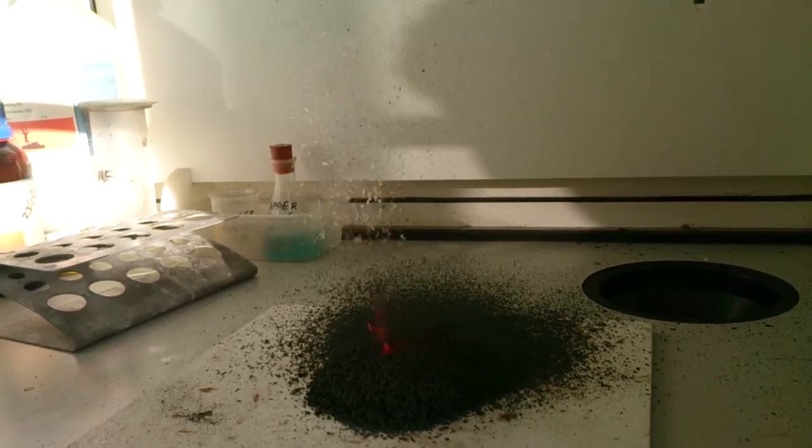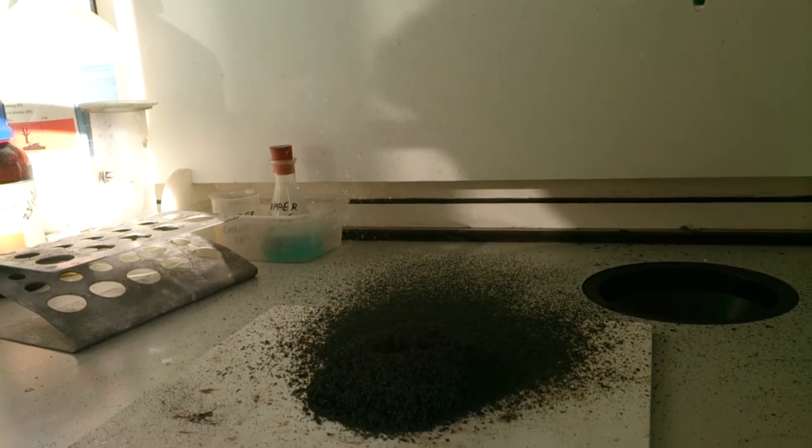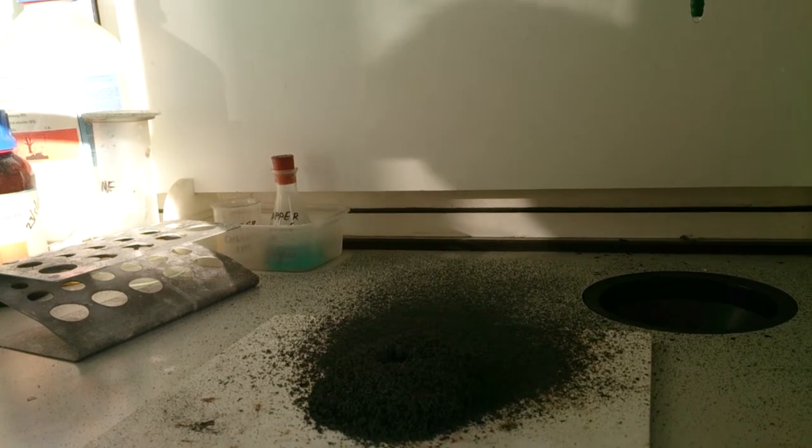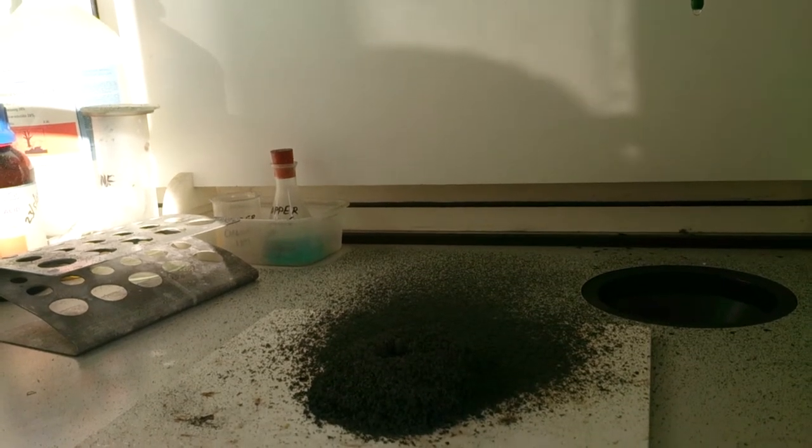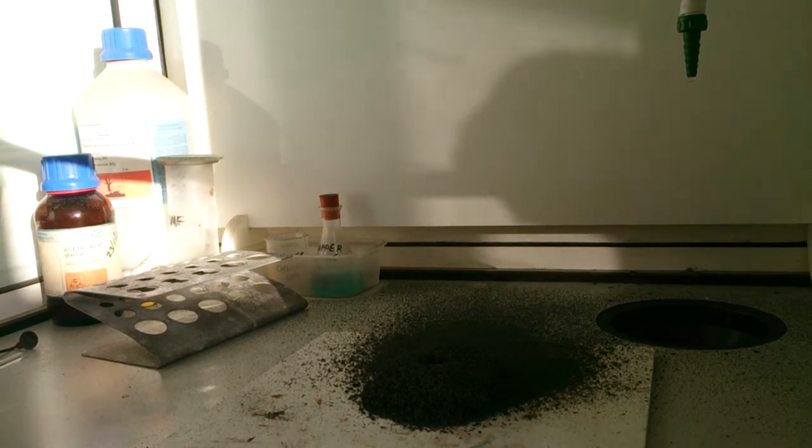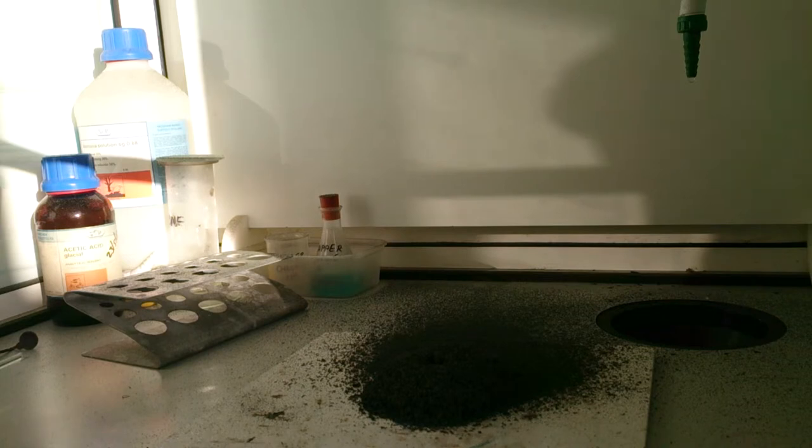You can see quite nicely there there's chromium oxide ash being produced. A nice green powder. There's quite a lot of smell of ammonia. So I'm going to put the fan on and draw out some of the smell.